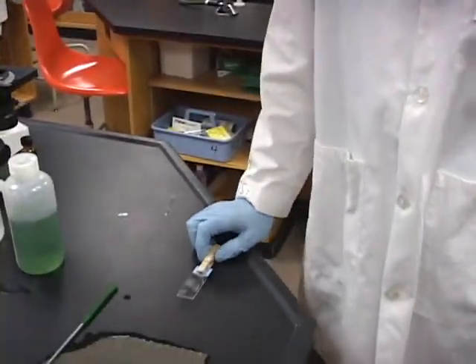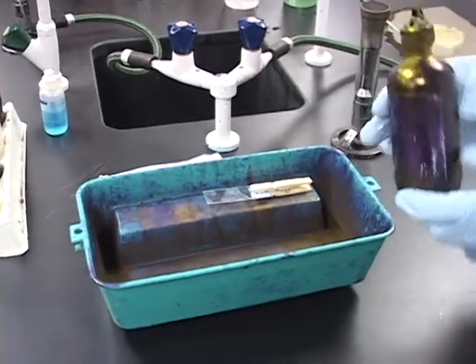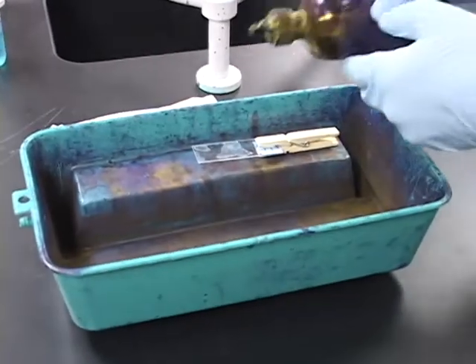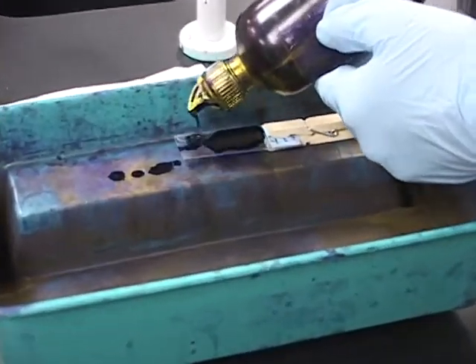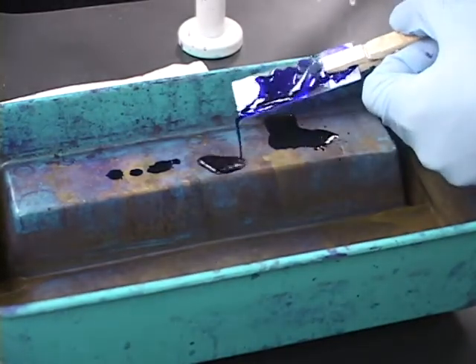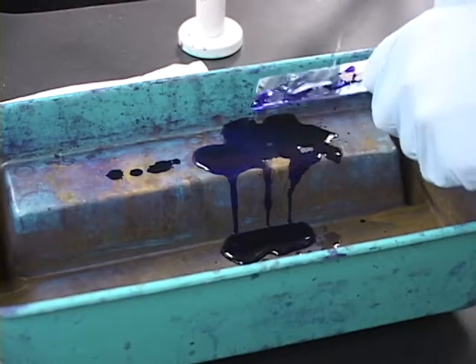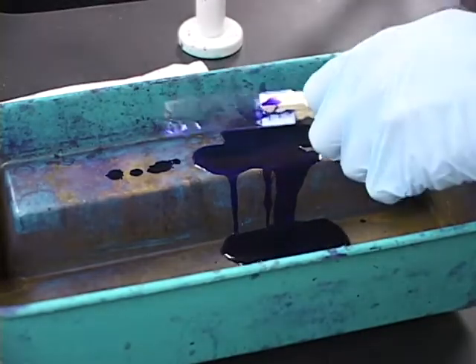The first step in the gram stain procedure involves the basic dye crystal violet, and it is the primary stain. The crystal violet stains all cells purple, and it highlights gram-positive cells. Crystal violet is applied to the heat-fixed slide for 30 seconds and then rinsed with water. Here is the crystal violet that we're using. And now we will rinse the stain with water. Then we will go off to Stephanie, who will use the mordant.